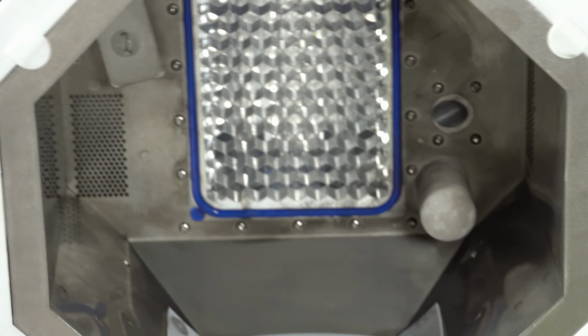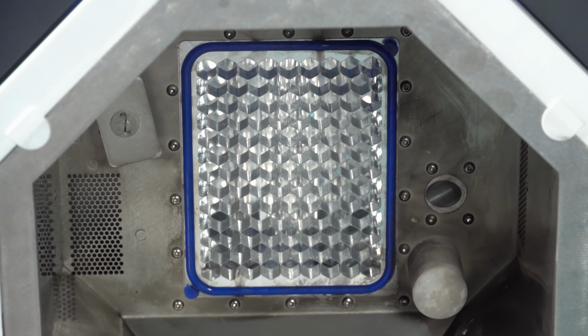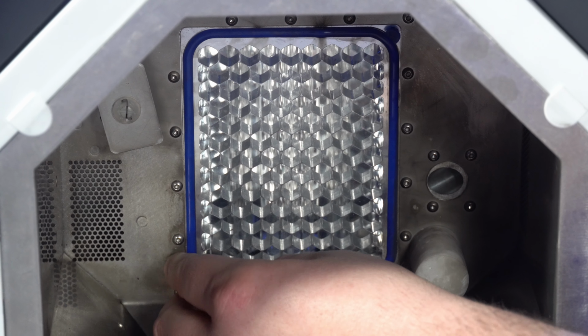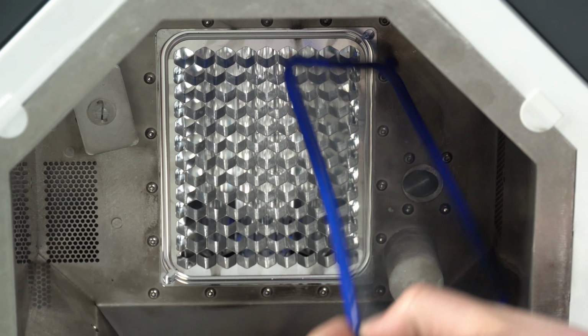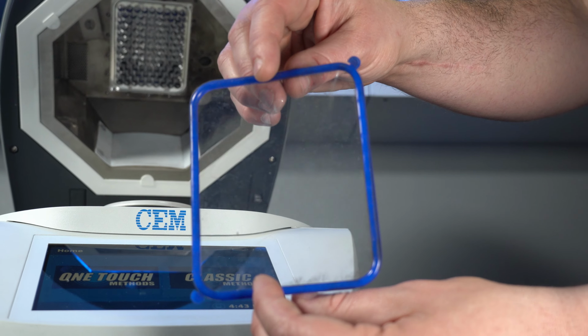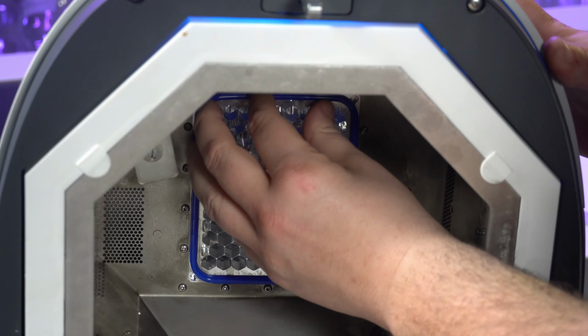If you're experiencing inconsistent results with your CEM Smart 6, one possible cause could be a damaged window film. To replace the film, open the lid, locate the thick plastic film covering the honeycomb-shaped area on the roof of the lid. Pull on the blue tab to remove the film. Replace the film with a new one, making sure that the rubber lining is fully connected, similar to how a Ziploc bag must be fully sealed.